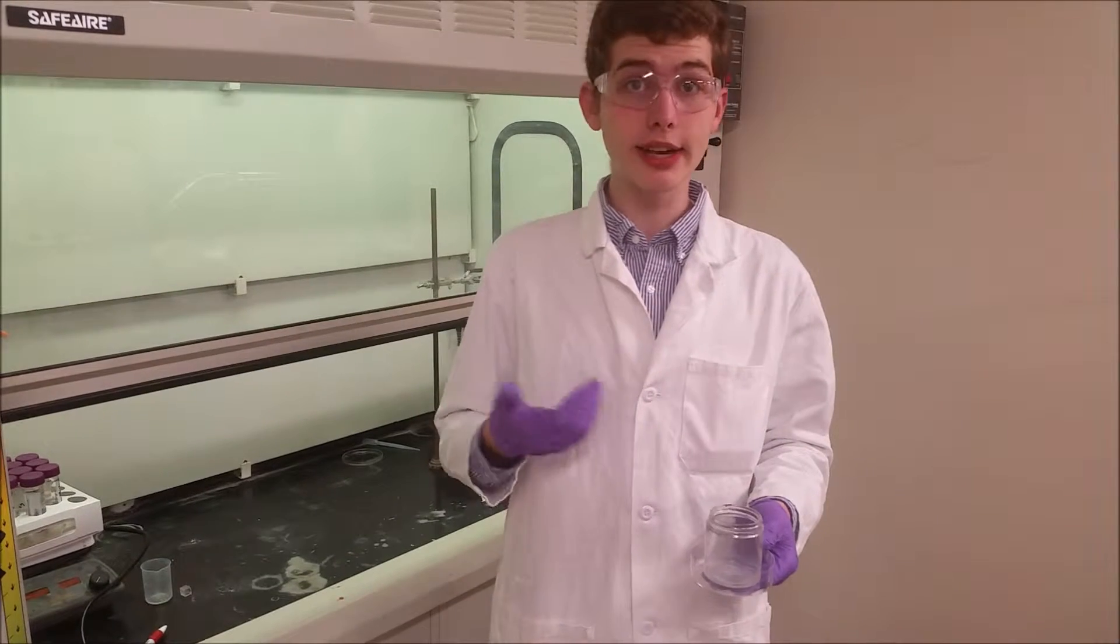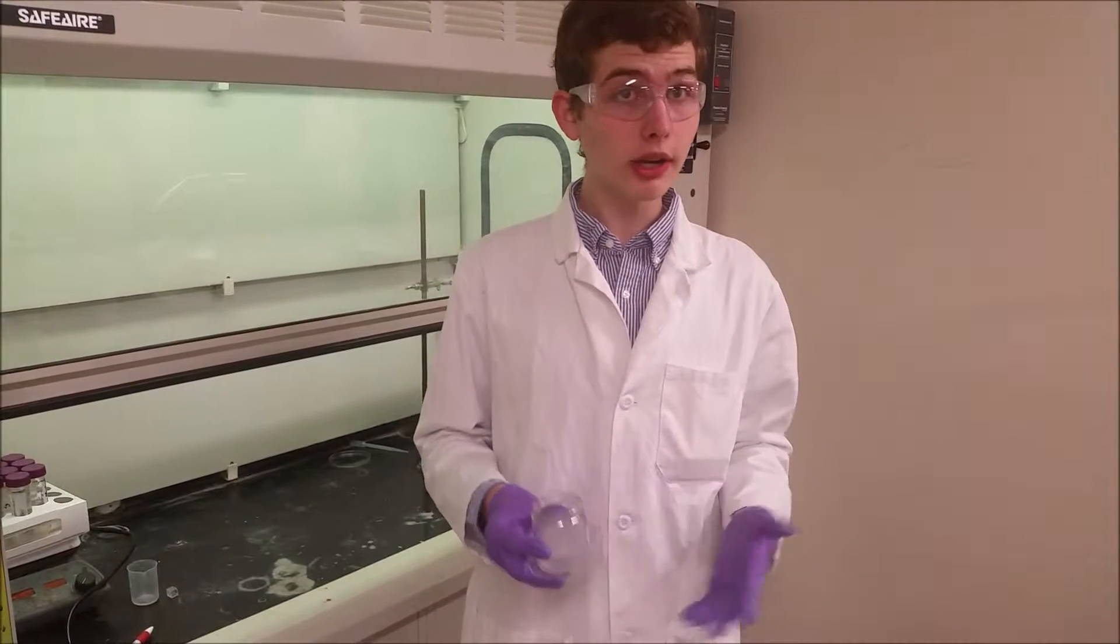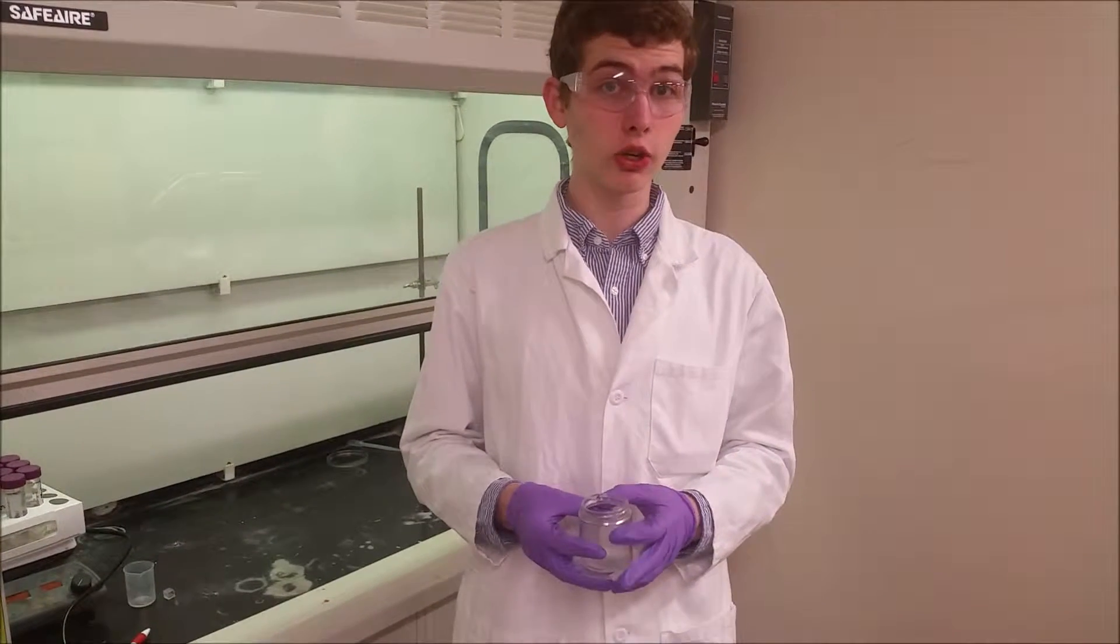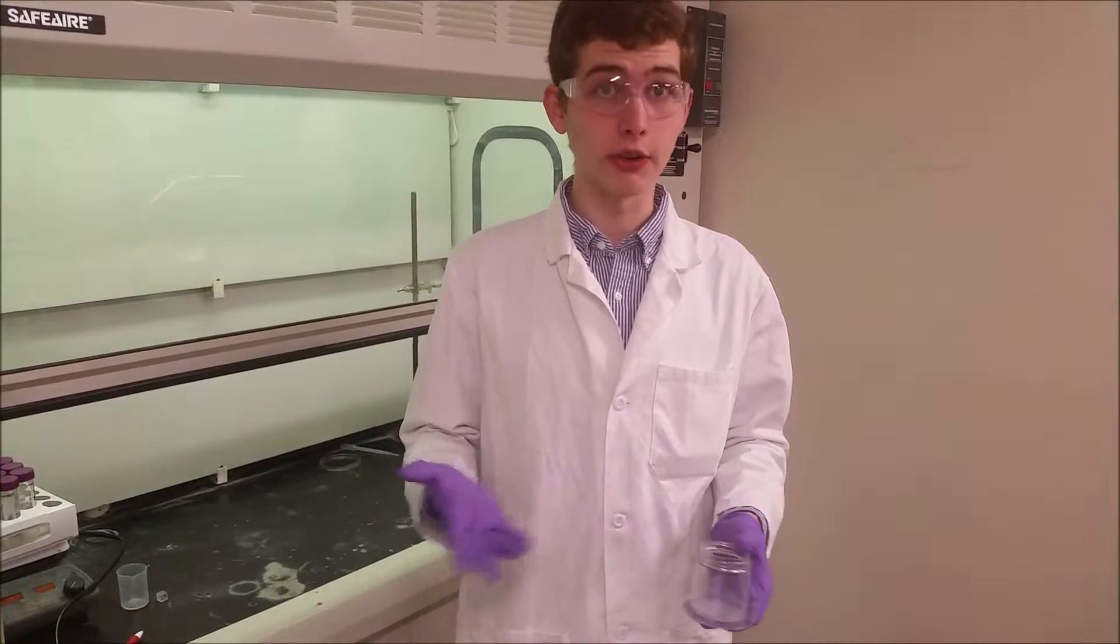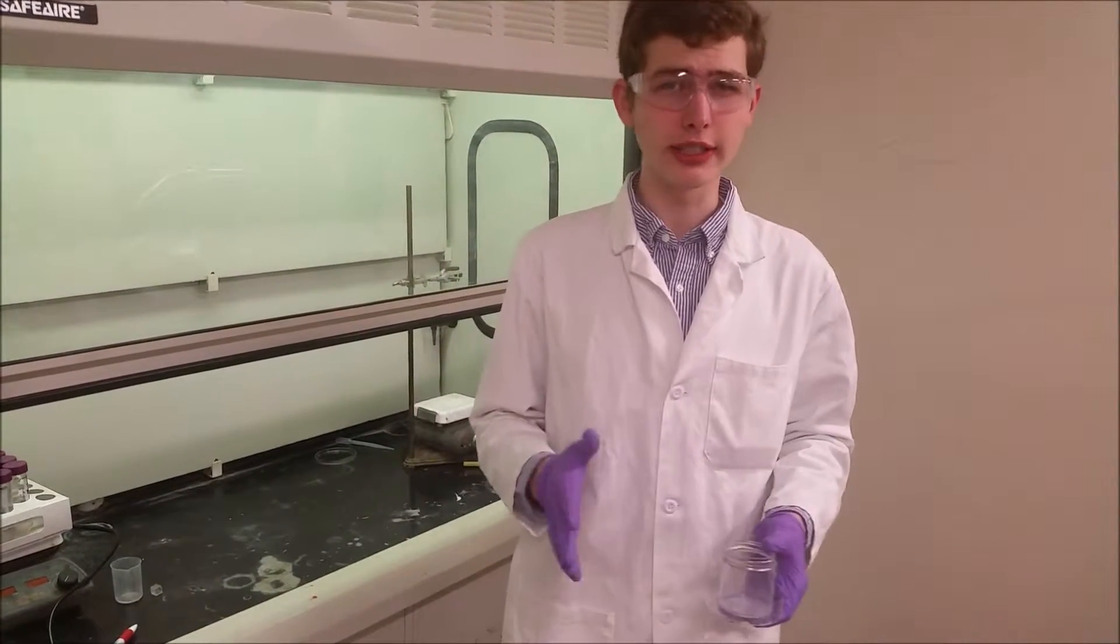We're going to be working with bleach and hydrochloric acid. Both are very dangerous, and the products we'll be making are acetylene and chlorine gas, also very toxic. Chlorine is a little bit worse.